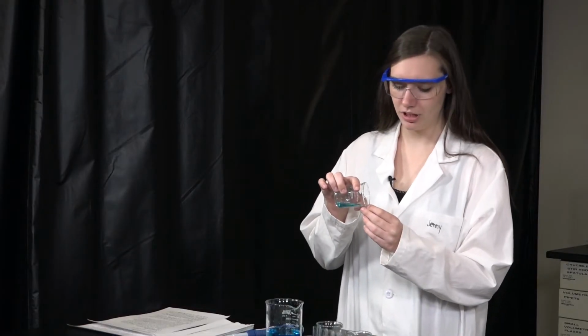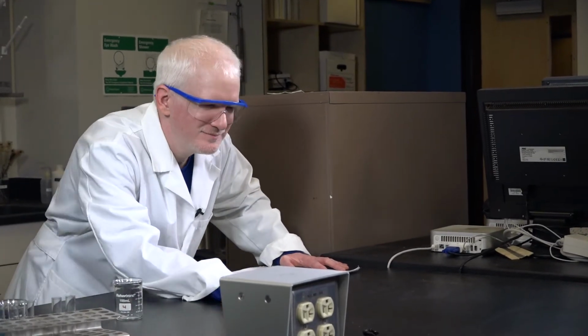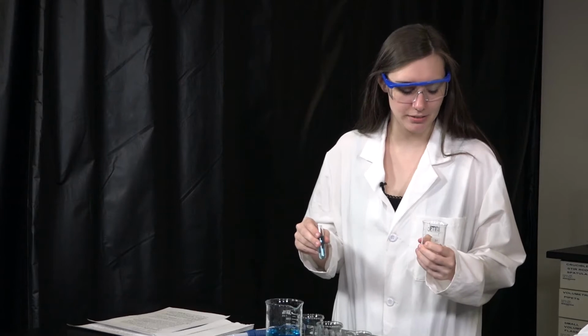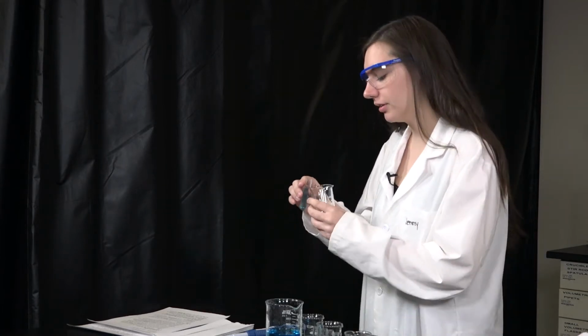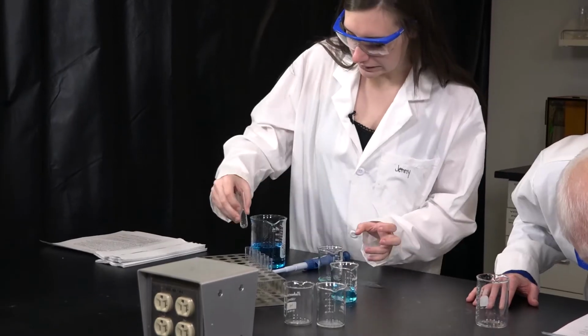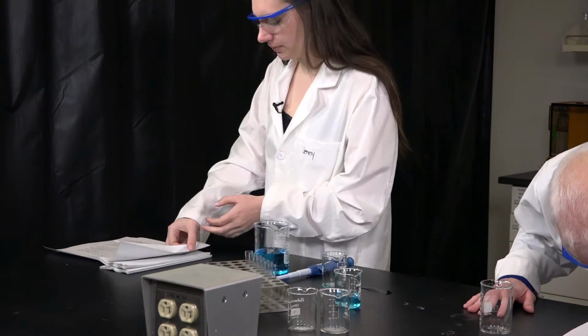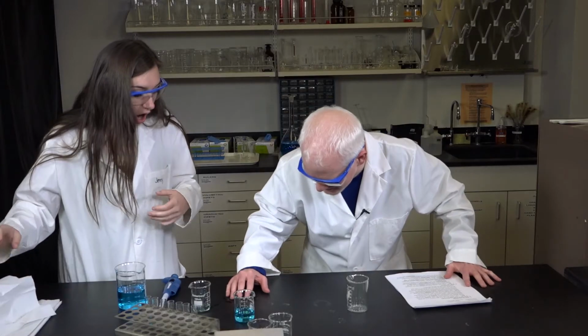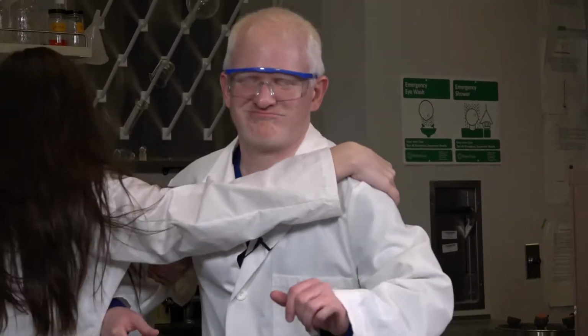Can you hand me that beaker? It's right in front of you. Sure. Careful. I got it. Sorry. Oh, what's that? Oh, here, come here, let me help you.